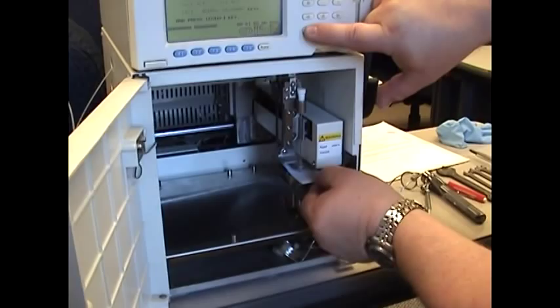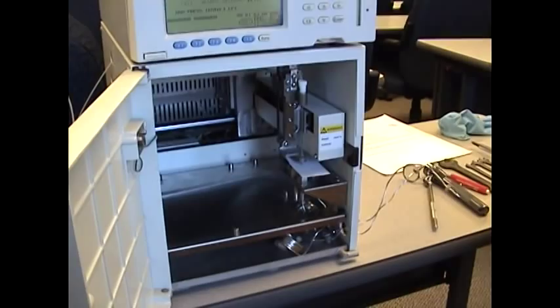There should be some resistance. It should not be poking through. You just want it at the top plane of that injection port.